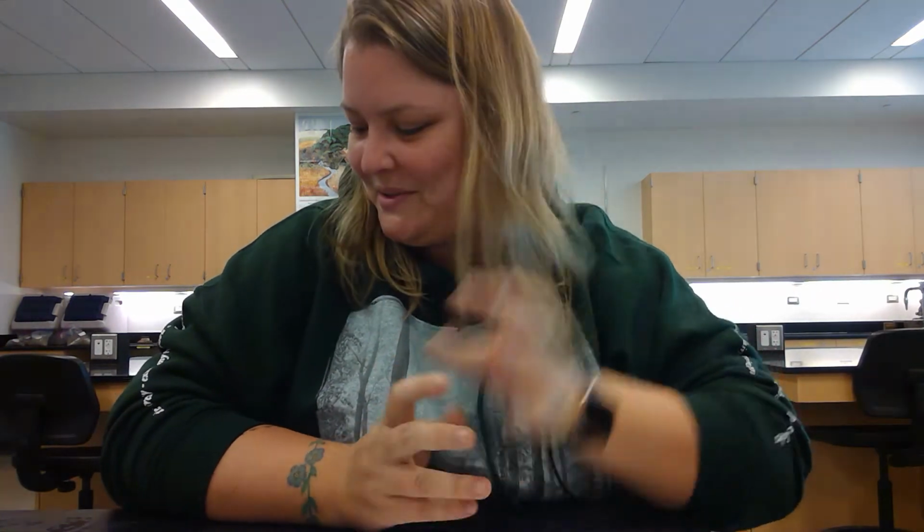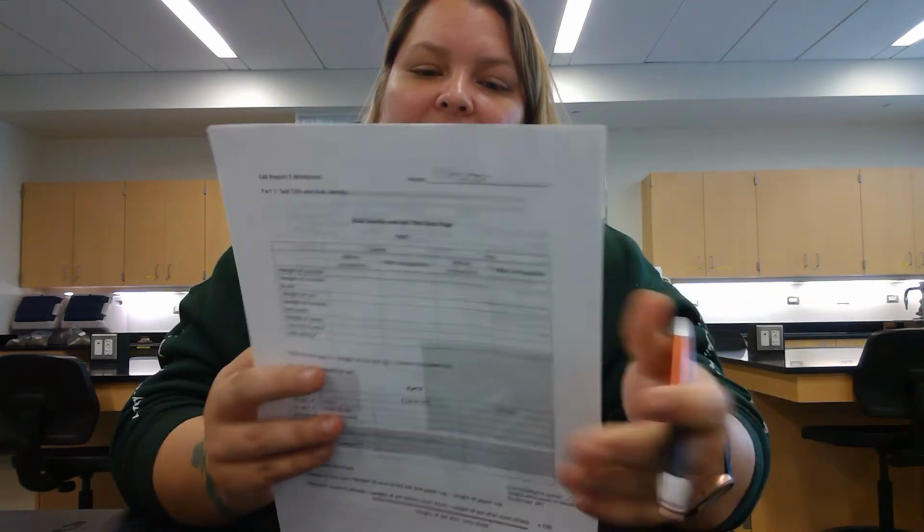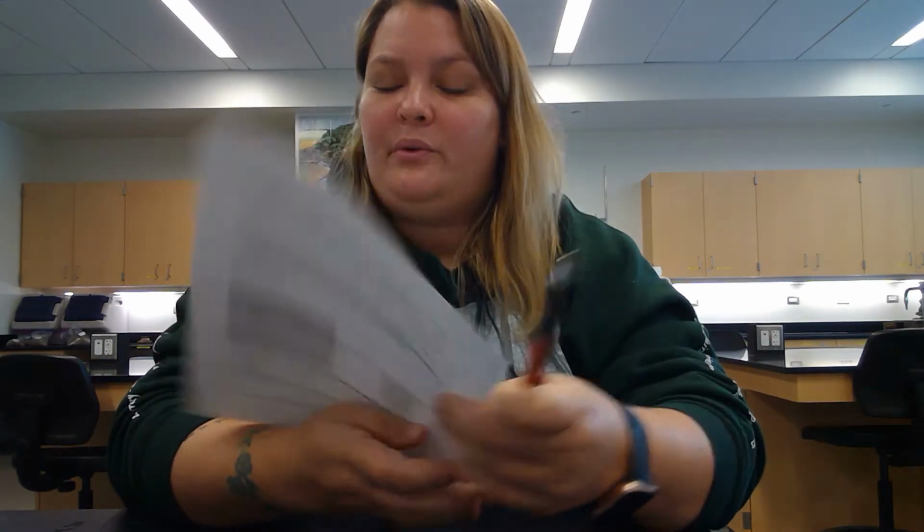All right, welcome to the online soils lab. Hopefully you watched the first video going through the PowerPoint slides, and now this is a video on what you would have actually done in class if you had been here. So have your lab report open so that you can fill out the numbers as we go through them. And so we're going to start with part one.